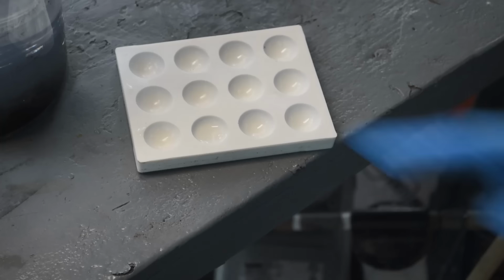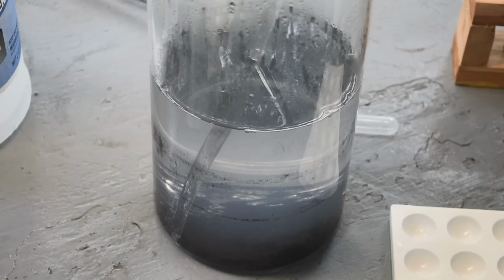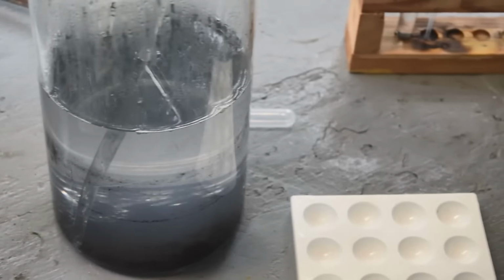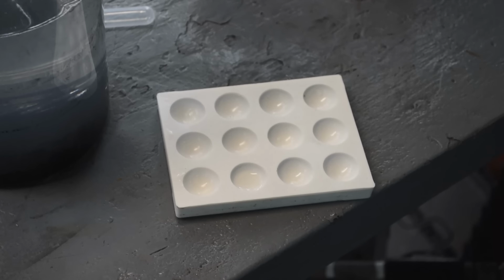Okay. But this liquid will go in my stock pot, and it won't go to waste. Over time, the rhodium can build up in the stock pot, and maybe next time I process the stock pot, or a few times down the road, more likely, there'll be enough rhodium in it to bother with trying to recover it. But yeah, that's interesting. I think there was some platinum in this stuff, and now it looks like maybe there's a little bit of rhodium too. All right, very cool.